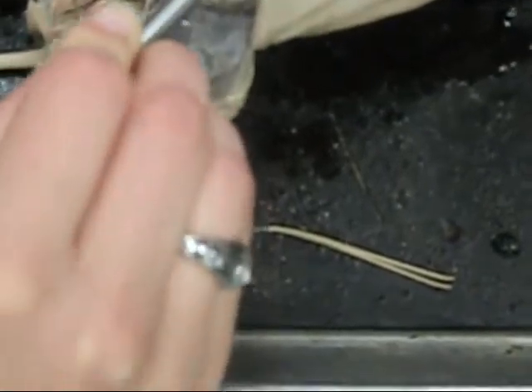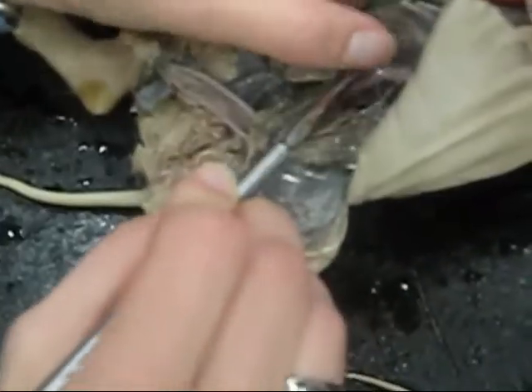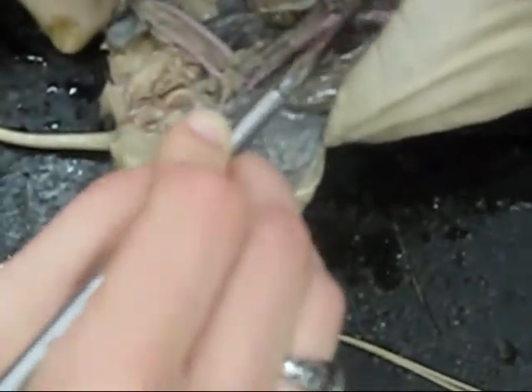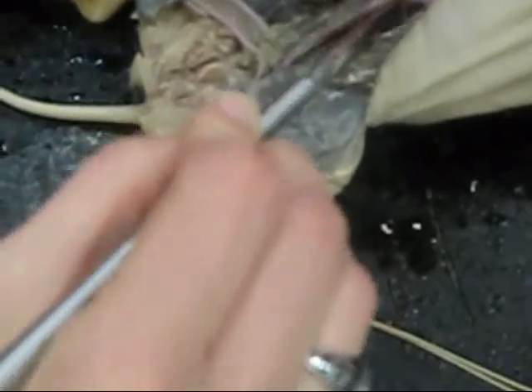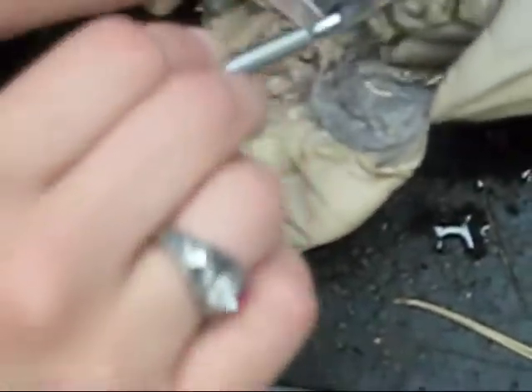Is the coeliac the first? Yes, that's the celiac right there. And then the second branch is really close to it. Right there? Okay, the anterior mesenteric. And then if you keep following it down, the next one you come to goes straight into the kidney. Is that the renal? Which makes it the renal. Does that make sense? Yeah. There we go. That was well done.